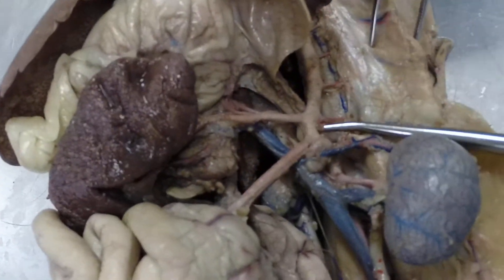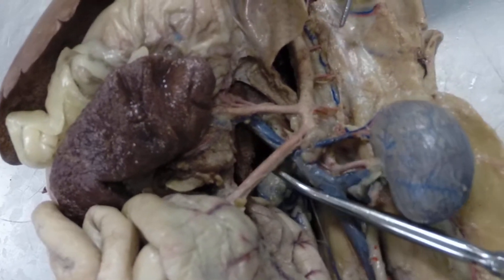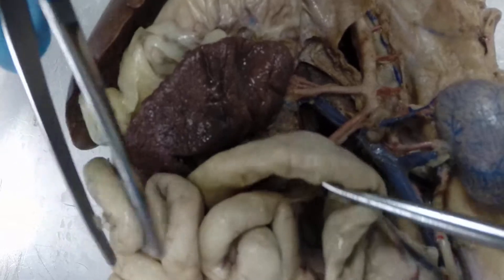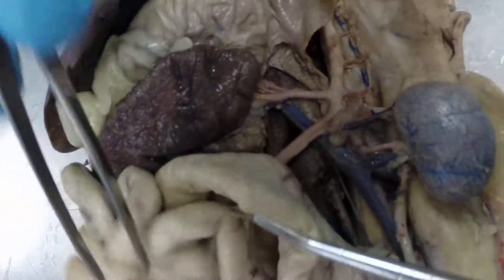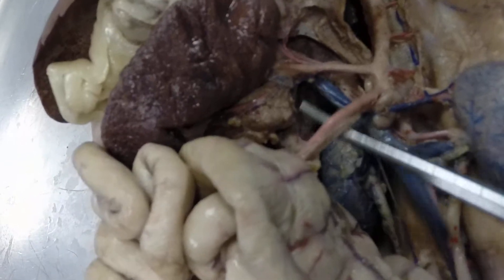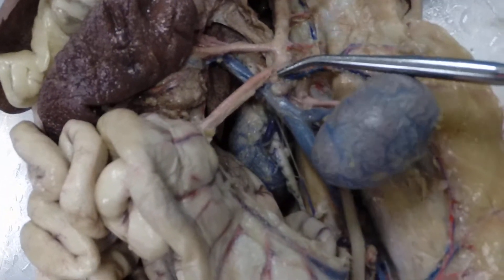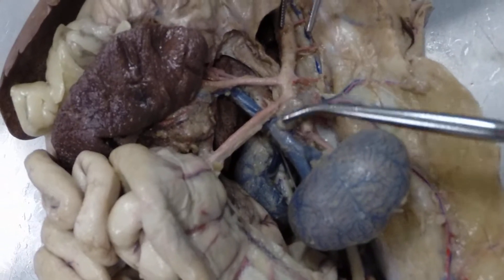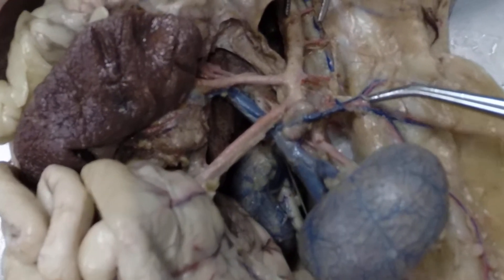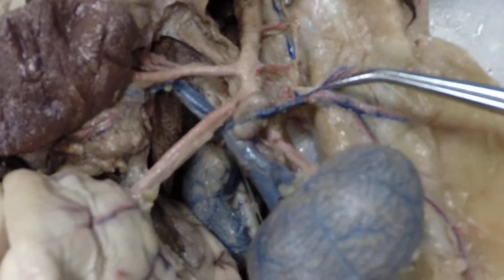Back on the descending abdominal aorta, the next branch is going to the small intestine — this is the large intestine here, but it's not going to that. This is the anterior mesenteric artery. Then continuing on, we come to the adrenal gland, and this artery is called the adrenal lumbar artery — this would be a left adrenal lumbar artery.